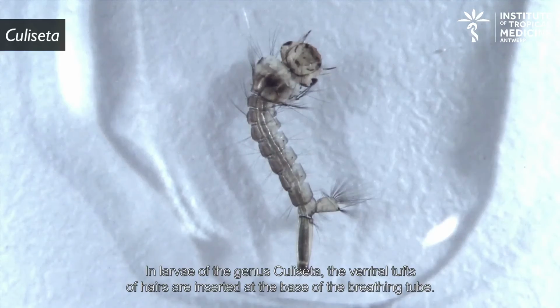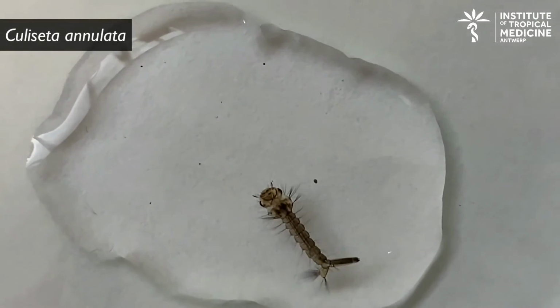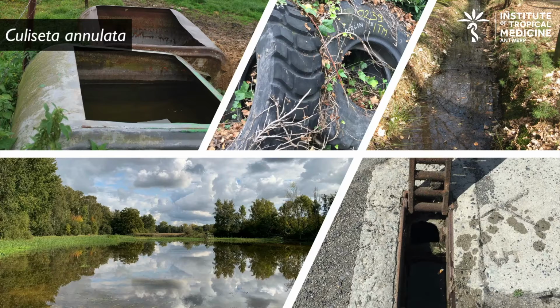In the larvae of the genus Culiseta, the ventral tufts of hair are inserted at the base of the breathing tube. A common species in Belgium is the banded mosquito or Culiseta annulata. The larvae live in similar breeding sites as Culex pipiens.